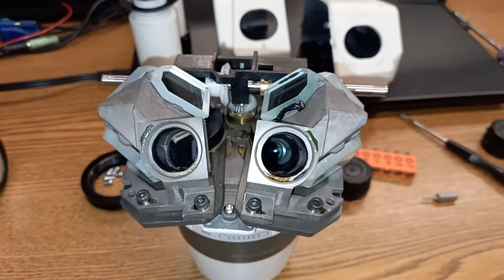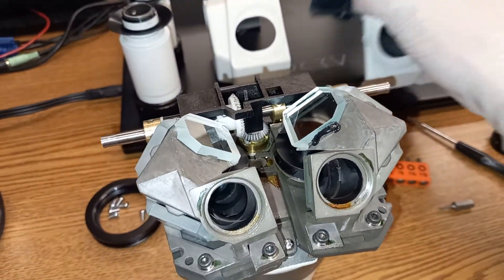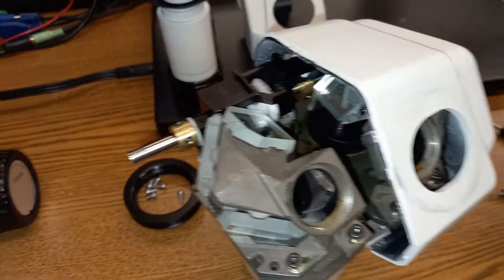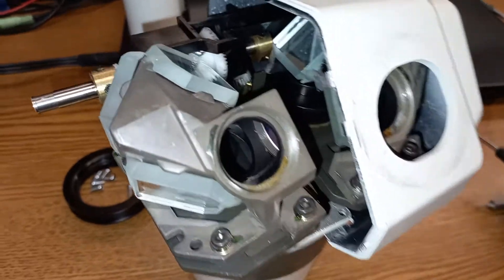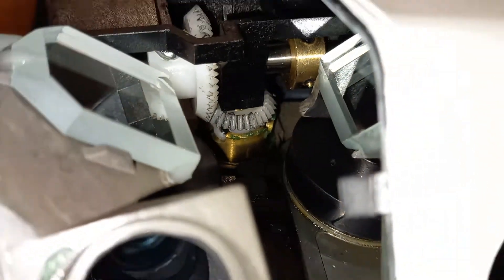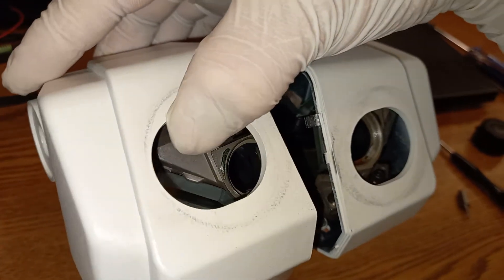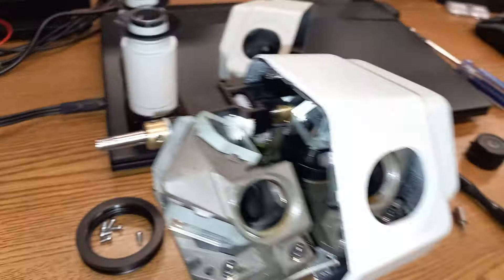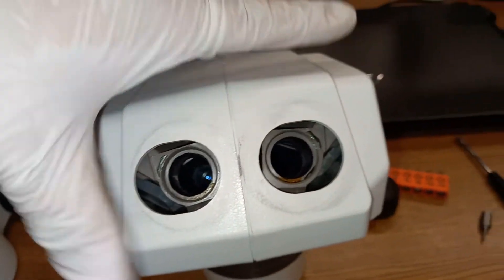I will demonstrate that in a moment, but first I need to reassemble this microscope. I will start with the housing — the housing needs to go on here. I was going to 3D model and 3D print this and place some new gears, but fortunately we don't have to do that today. Maybe sometime in the future, but for now at least we know the root cause of the problem. So I will place the housing here, and after I put the housing together with both hands and put down the camera, then I will place this one on. Basically, I snap these two together on both sides of the housing.